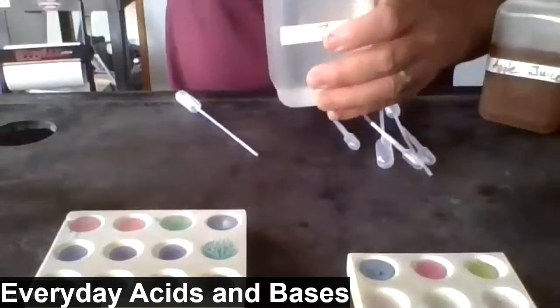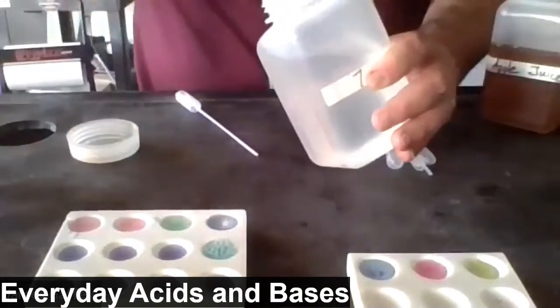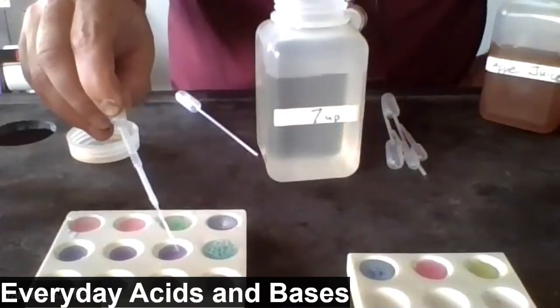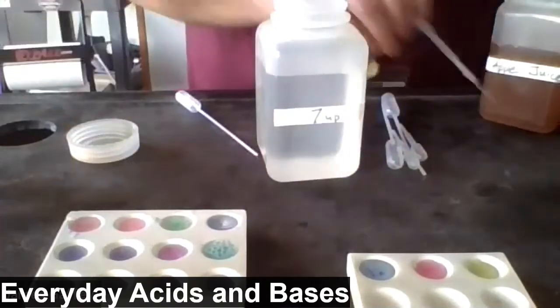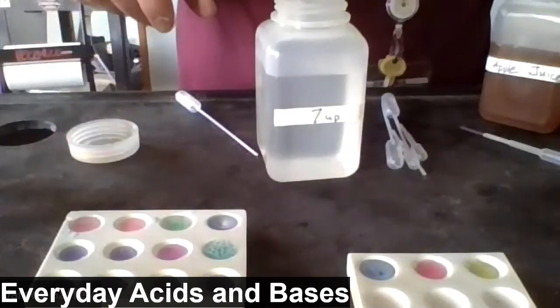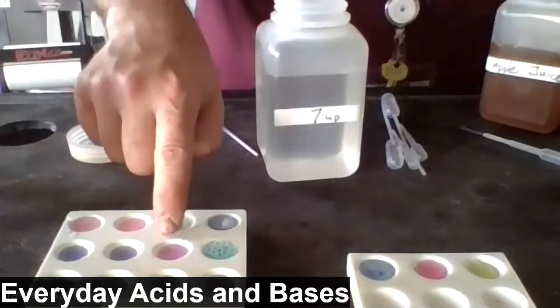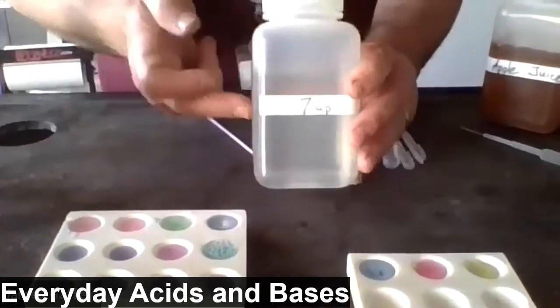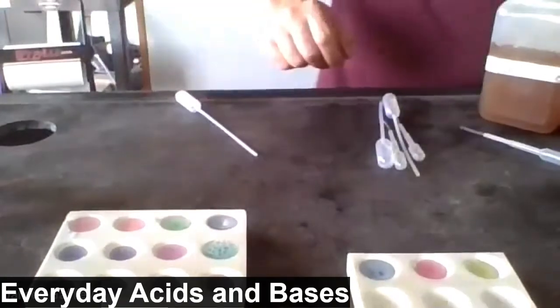Seven Up. I'll add the 7-Up to this well. Similar to the other drinks we've seen, the lemonade and the Mountain Dew so far, we see a reddish color with 7-Up, which again would lead us to believe that 7-Up is probably acidic.